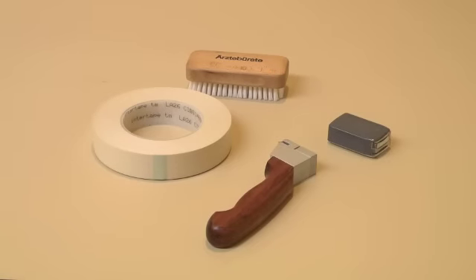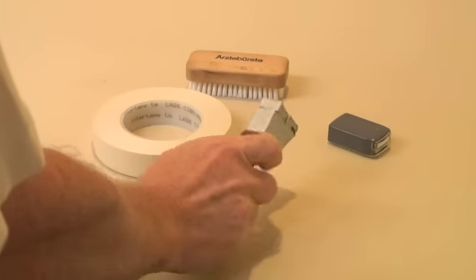Welcome to the BYK-Gardner video on crosscut testing. Here we will show you how to use the BYK-Gardner crosscut tester.